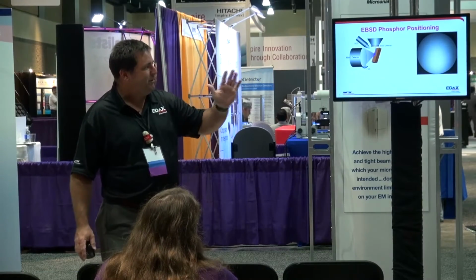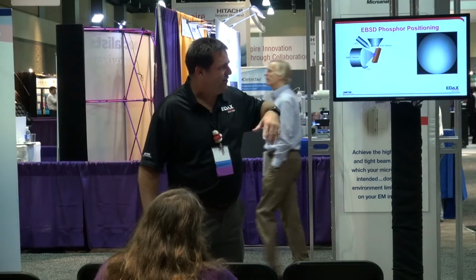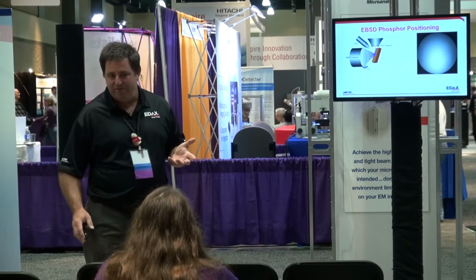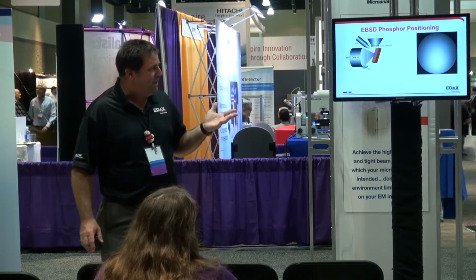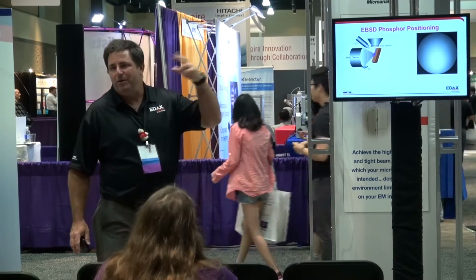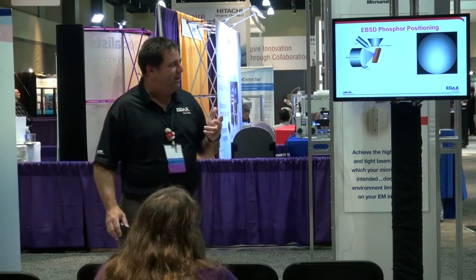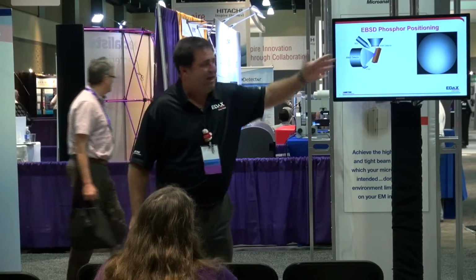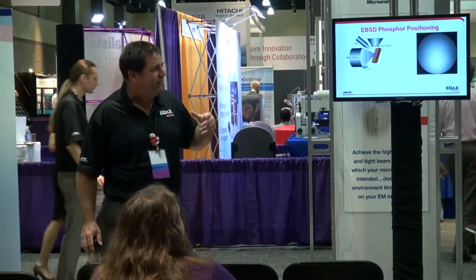And so when we've tilted the sample to 70 degrees, which increases our backscattered yield out towards our EBSD detector, we've positioned our EBSD detector in space to try to optimize that collection. That's why we've put it there. And so generally the solution has been, if we want to image for a tilted sample, you'd put a forward scatter detector somewhere around the perimeter of the phosphor screen. So the thing to remember is it was put there not because it's the optimal position for a forward scatter detector, it's the area that was available without blocking your phosphor screen, which was the primary emphasis of the system.